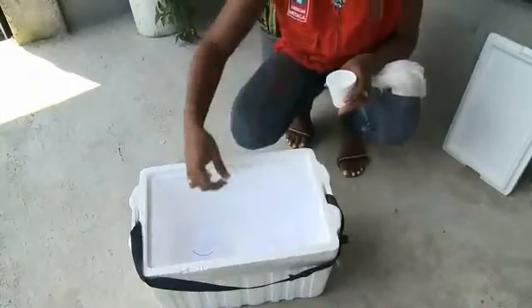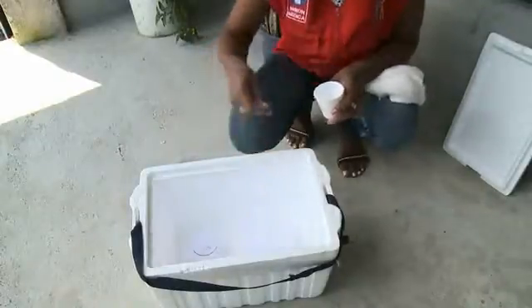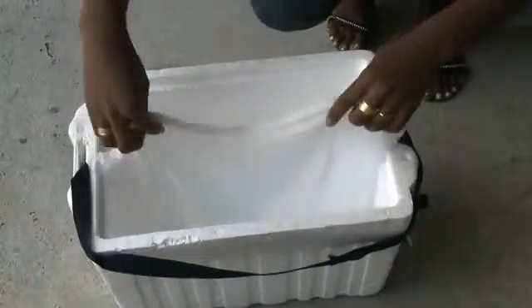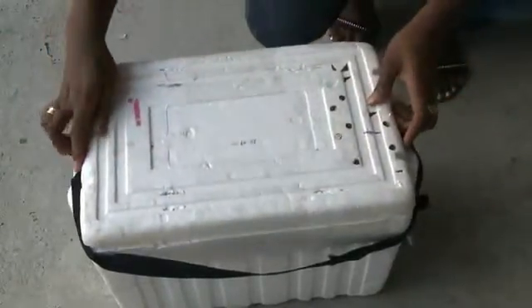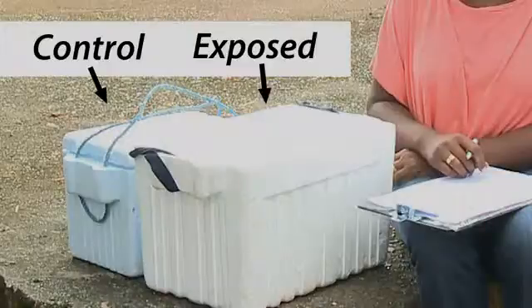Place a piece of cotton wool damp with a 10% sugar solution on top of each cup. Put the cups in an insulated box and cover with a damp towel. Cover the box and protect it from ants, placing it on an elevated surface. The cups with the control mosquitoes should be kept separate from exposure cups.